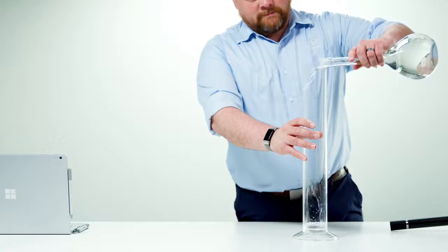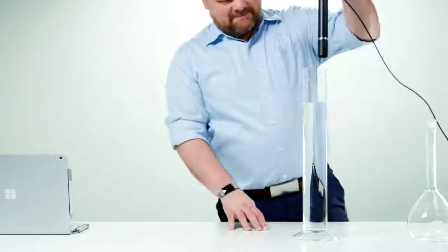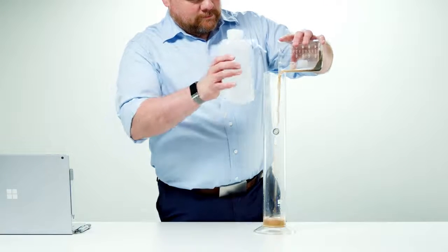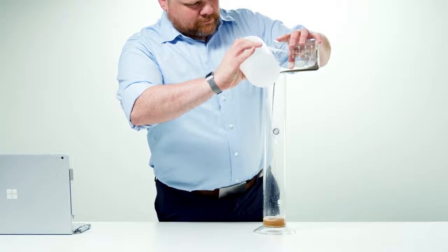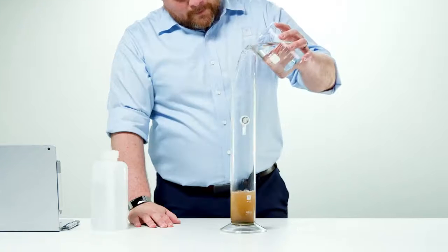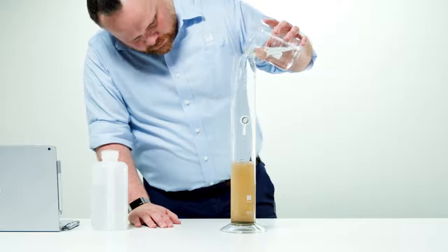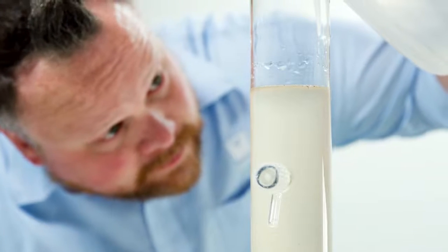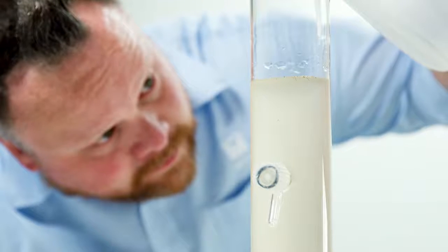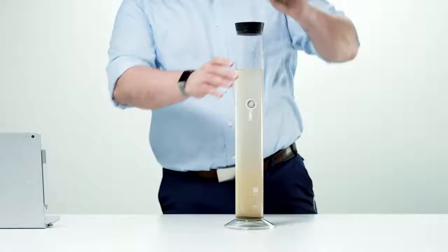Fill the standby cylinders to 1 liter with room temperature distilled water. Put the PARIO devices into the standby cylinders. Transfer the dispersed soil sample into the sedimentation cylinder. Use a wash bottle with distilled water to ensure the whole sample is transferred. Fill the sedimentation cylinder with distilled water to bring the level of liquid to the 1000 milliliter mark, ensuring the meniscus touches the upper line of the mark. Be sure that the distilled water is room temperature. Place the rubber stopper on the sedimentation cylinder to avoid evaporation.